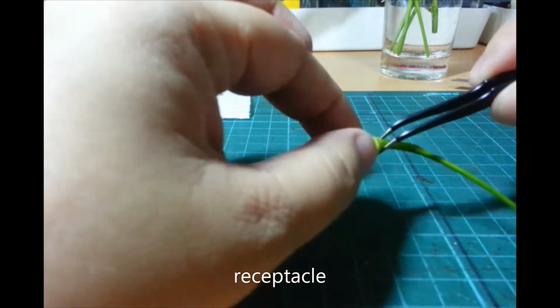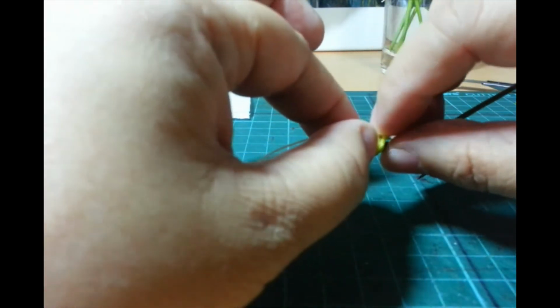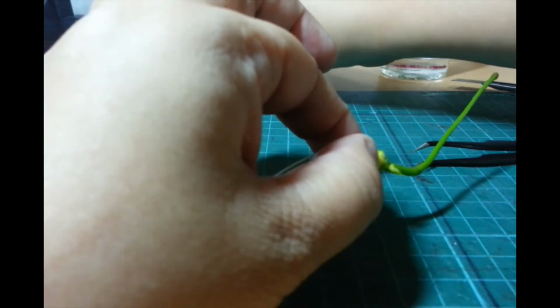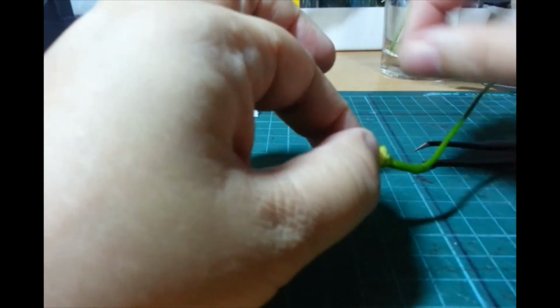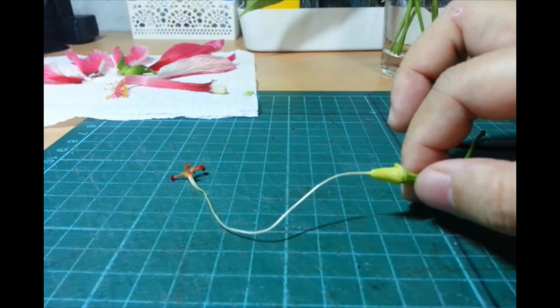Binabanggit ko na rin kasi, alam nyo, pagkatapos ng fertilization, double fertilization that happens in the case of the flowering plants, ang nangyayari dyan, diba? Magiging fruit yung some parts of the flower. And in some flowers, the receptacle actually becomes the fleshy part of the fruit.